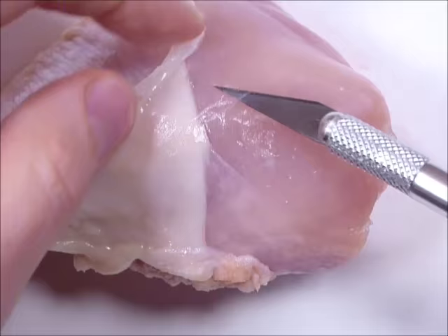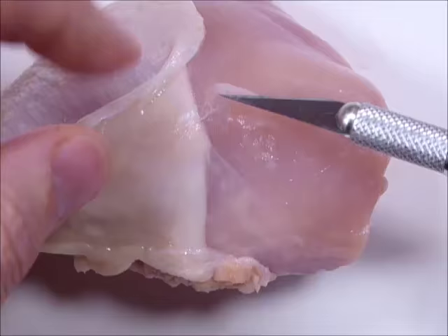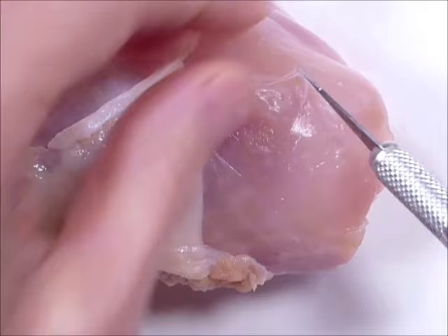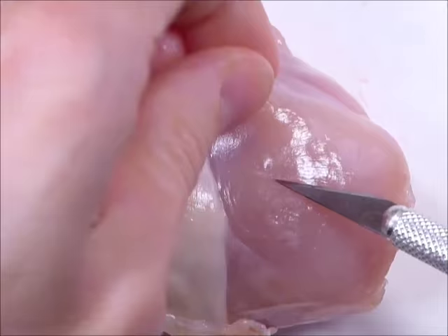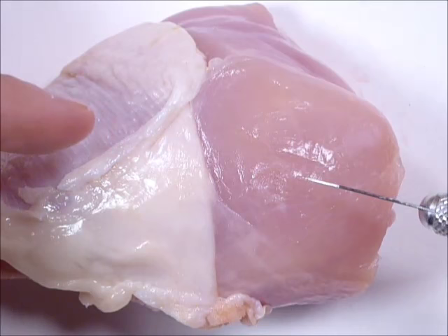See how I have that little bit pulled up? This muscle is in a bag, and I've put my blade right under the bag. It's very thin and transparent — you can see through it. If I peel it away, there we go. The muscles are wrapped in several layers of bags: the little ones are in bags, grouped together in larger bags, and the whole thing is in a bag. It's a bag of bags of bags.